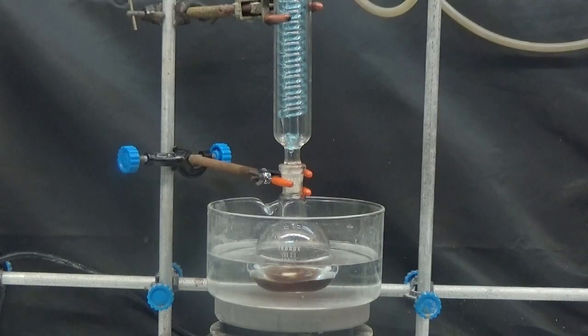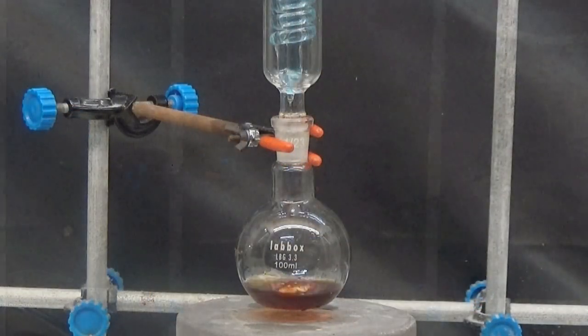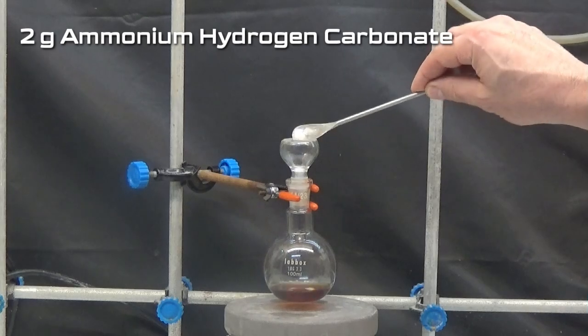Heat for 1 hour at reflux with a hot water bath at a temperature of 75 degrees. Allow to cool with continuous stirring. Add 2 grams of ammonium hydrogen carbonate.